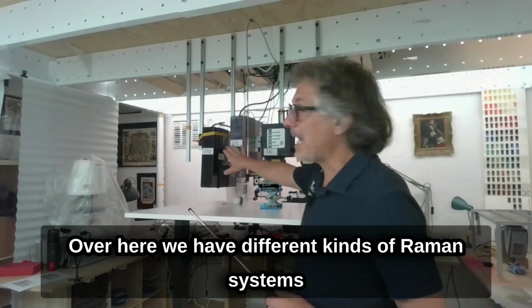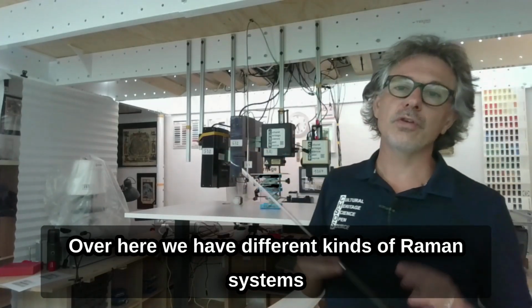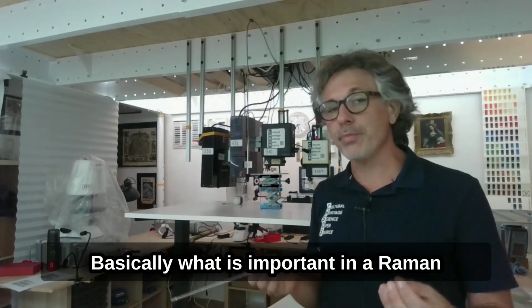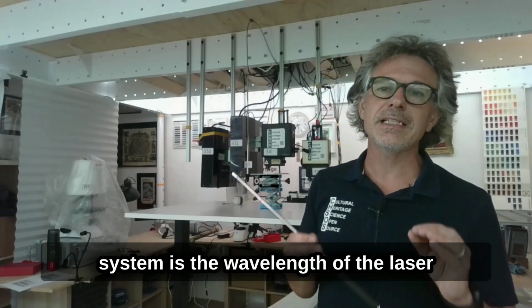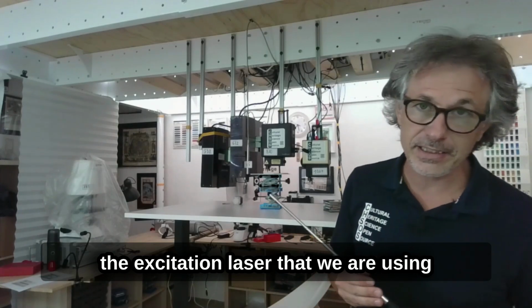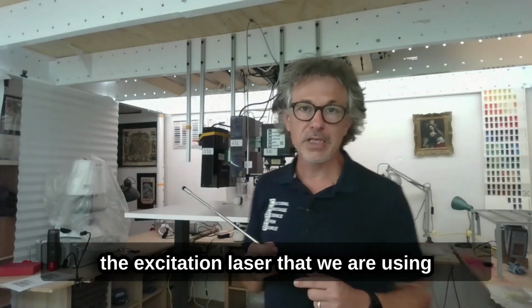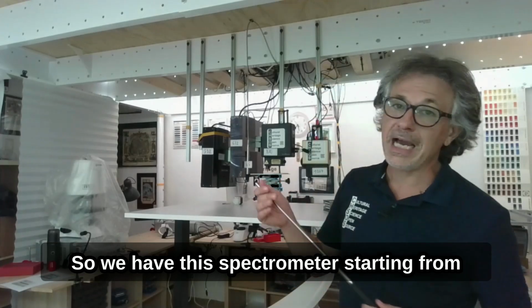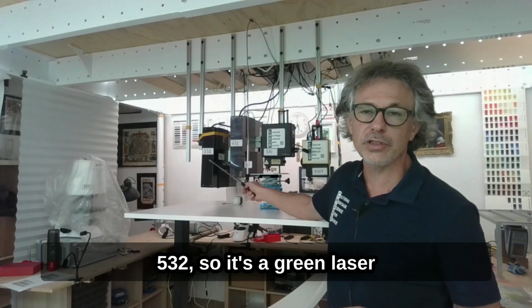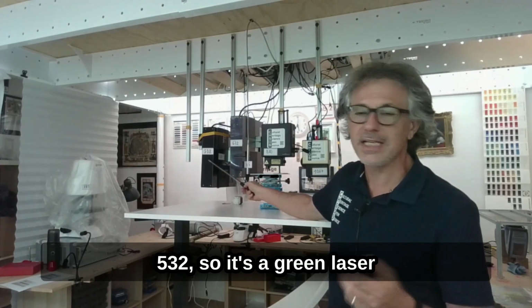Over here we have different kinds of Raman systems. Basically what is important in a Raman system is the wavelength of the excitation laser that we are using. So we have this spectrometer starting from 532, so it's a green laser.